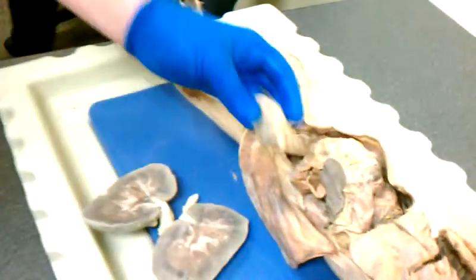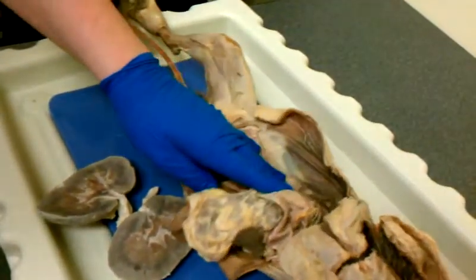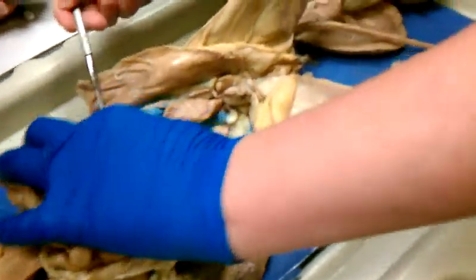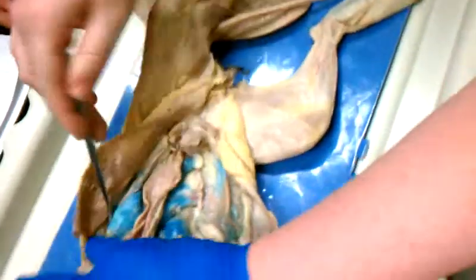So here's one kidney. It got removed. Students in my lab have fun sometimes. Might as well use this one. Oh, there is one isolated. Here it is. Here it is. I isolated one, but not the other. Alright, so this one's covered in fatty tissue, but this one's not. These are both the kidneys, though.